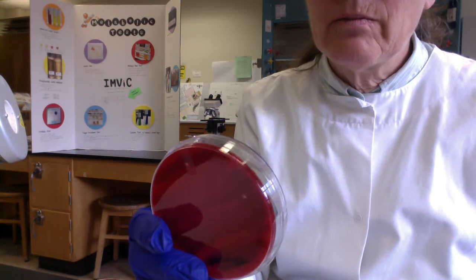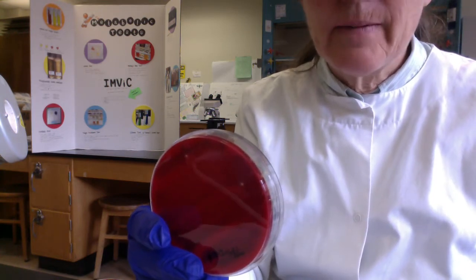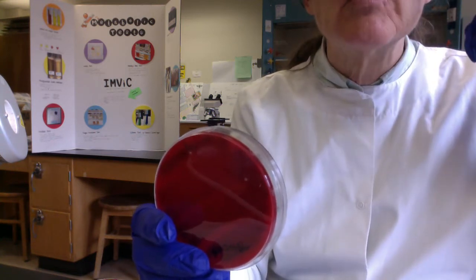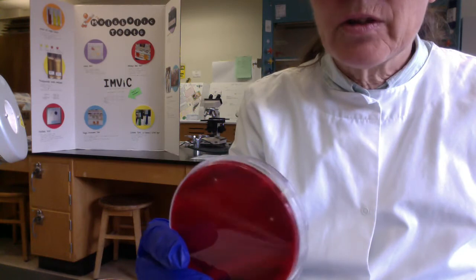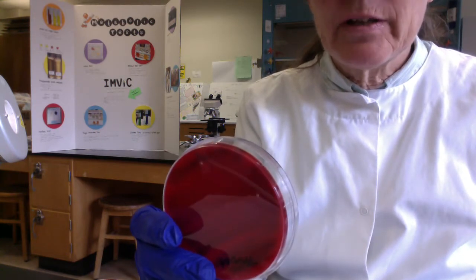Now, another microbe that I've recovered from the back of my throat is Staphylococcus aureus. And this makes sense because if we're colonized in our nose, it makes sense that we could have Staph aureus that would be moved just from secretions to the back of our throat. So I've also recovered beta hemolytic Staph aureus from the back of my throat.